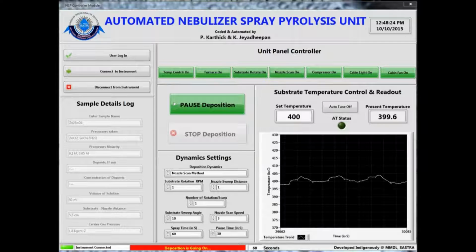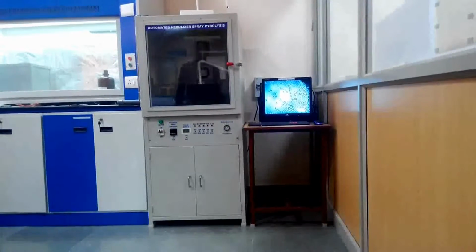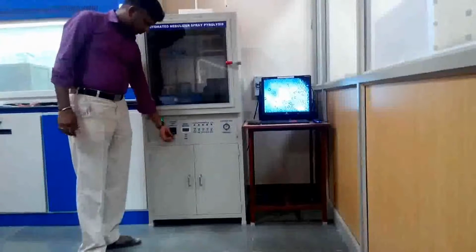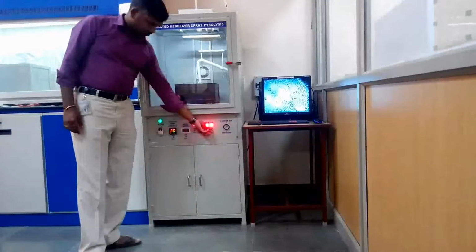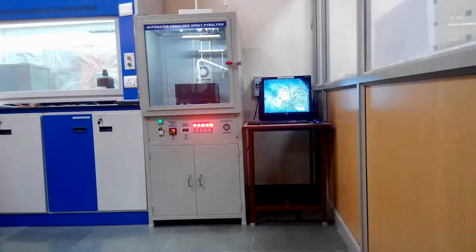This is all about the instrument. Now, a short demonstration is going to be given to successfully prepare thin films using the instrument. At first, the instrument should be powered up and all the manual override controls present in the control panel should be switched on. An override operation is implemented between the front panel controls and the software controls. Hence, even though the front panel switches are on, they should be switched on in the software also.